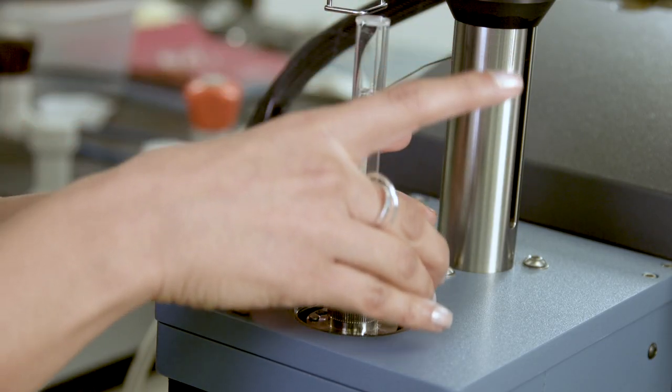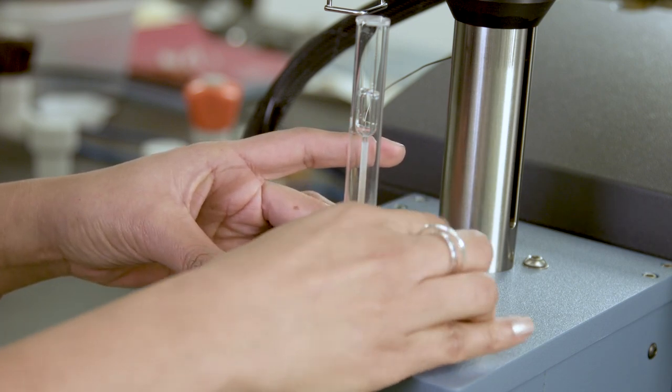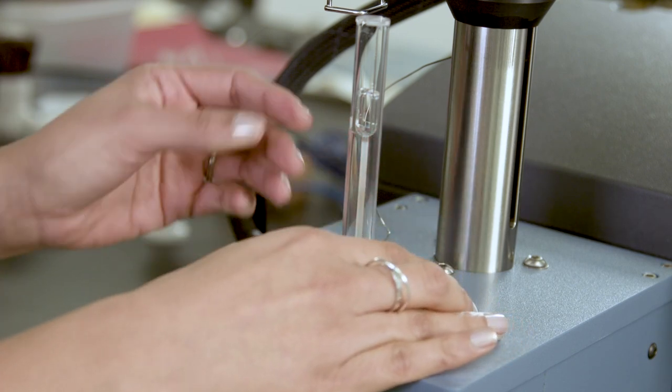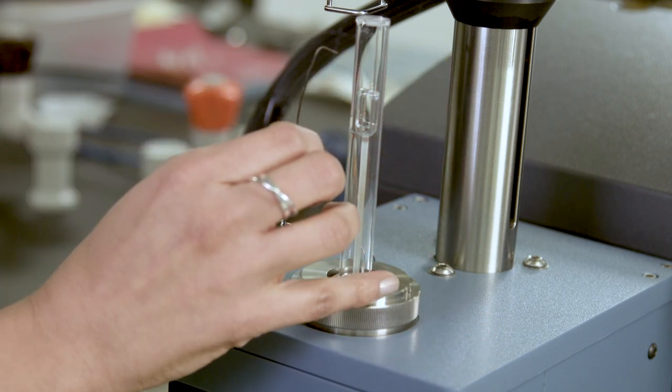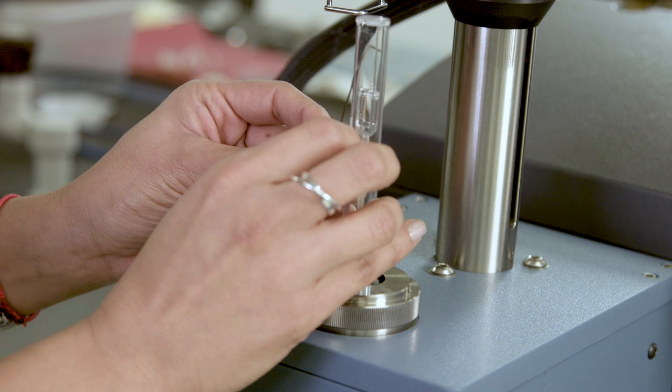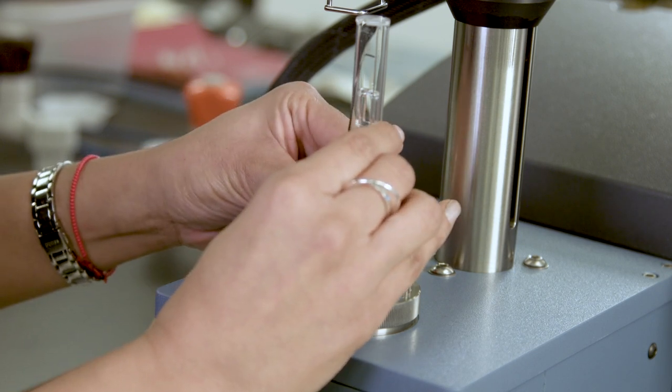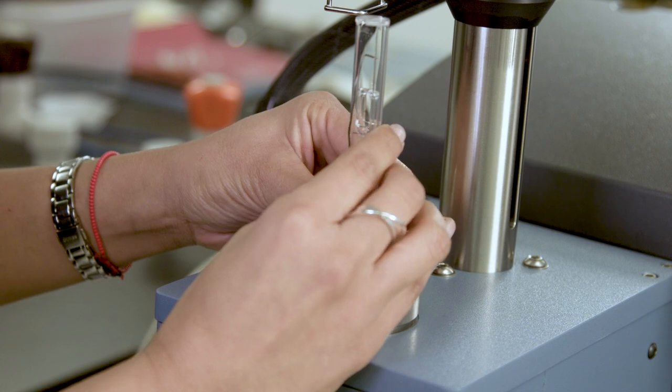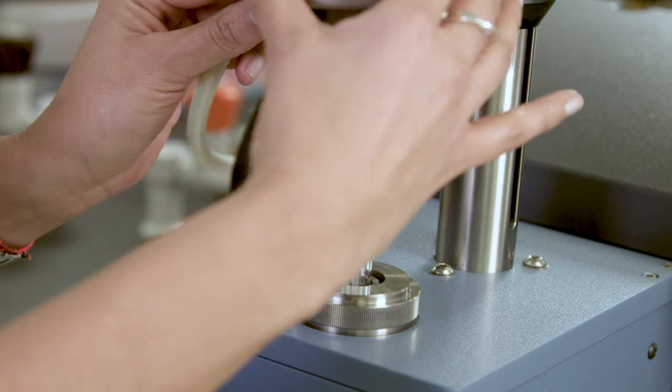Place the large stage nut and turn it clockwise to install it. Position the tip of the thermocouple around one half the length of the samples you will be measuring. The thermocouple must be close to, but not touching the sample.